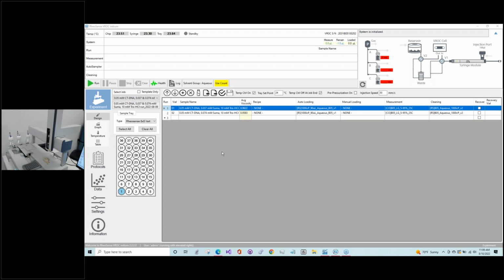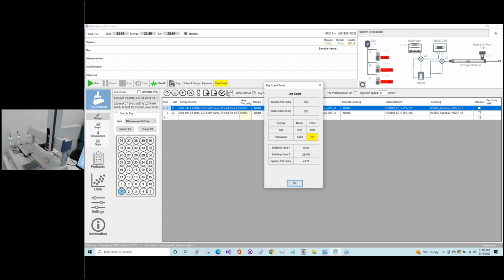So another thing I like to check is in our Initium software. There are some indicators here. The first thing we will check is the use counts, since it's highlighted. These are the use counts for some of the common things that we ourselves can change, and some of them we will show you today. If they are highlighted yellow, that means they're getting close to needing to be changed. So on this software, it's saying our piston here for our autosampler is getting close to its end of life use. So we need to be a little cautious of that. Everything else is not highlighted, so those are good.